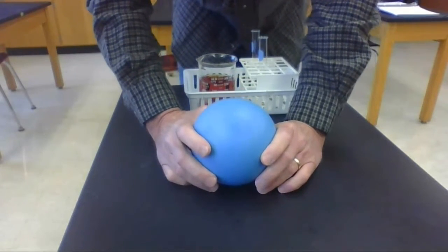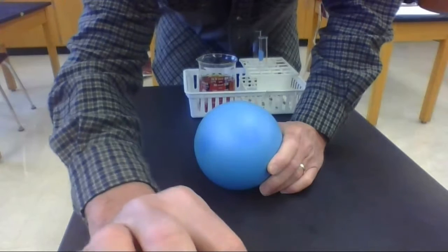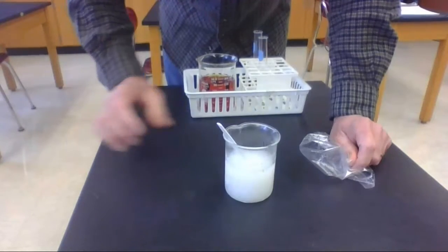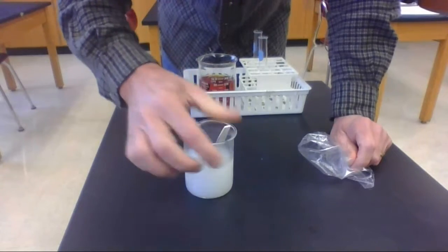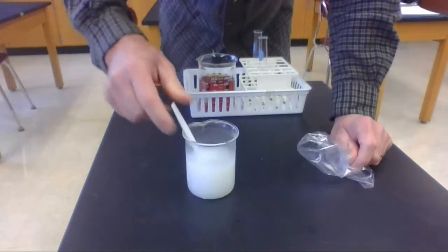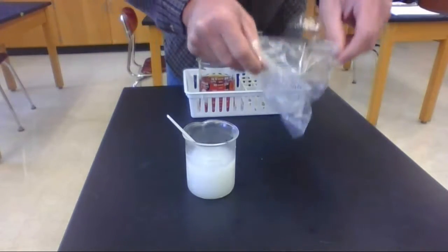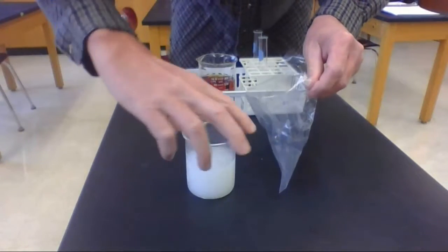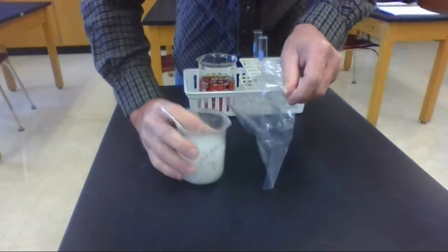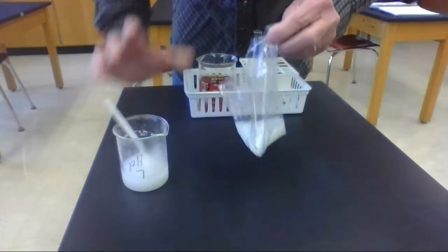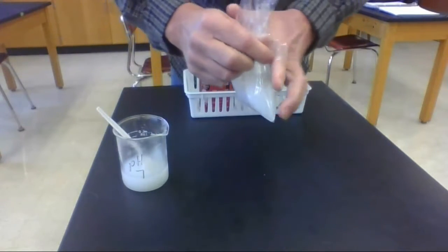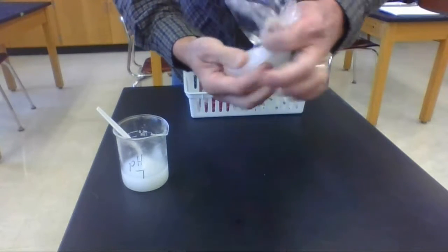To do that, we're going to create a model. What I have here is just a little bit of cooking starch that we put in a beaker. And here I just have a regular old sandwich bag. And I'm going to pour some starch, just doesn't matter how much, into this sandwich bag and twist it shut.